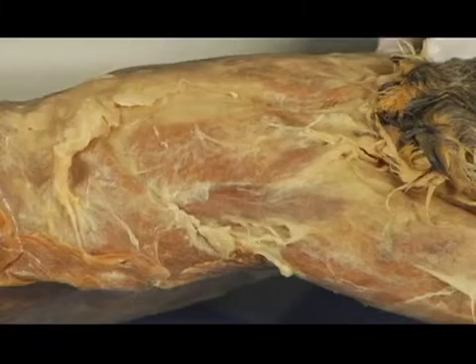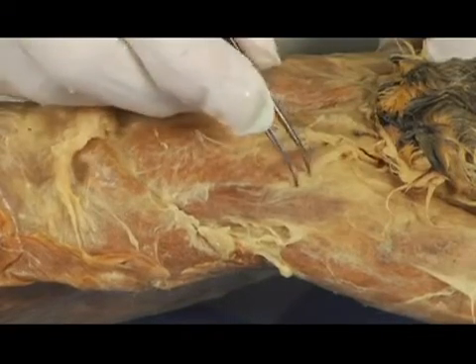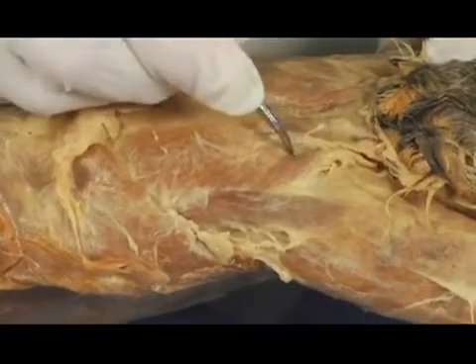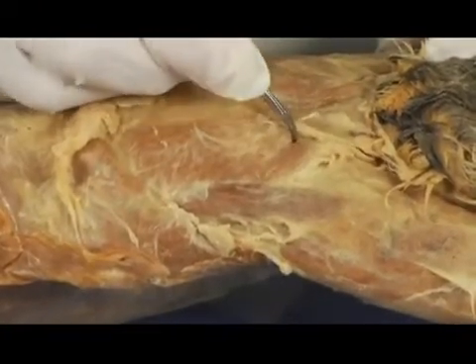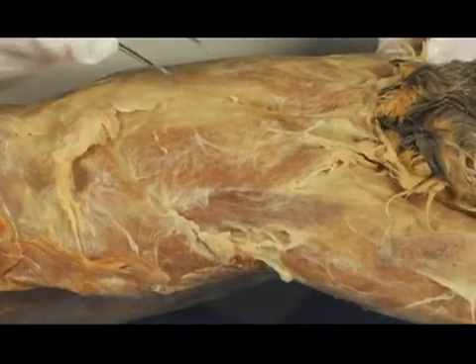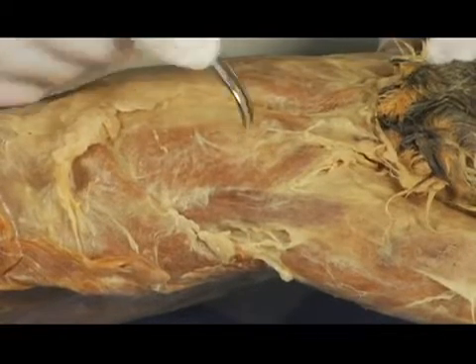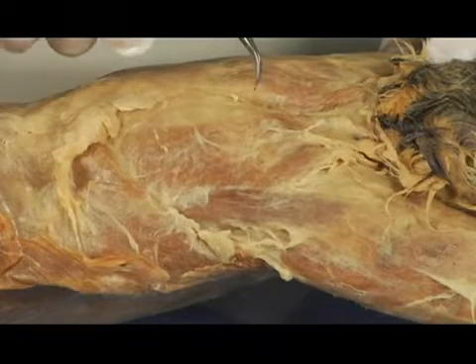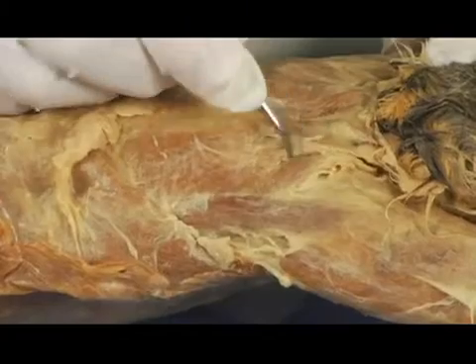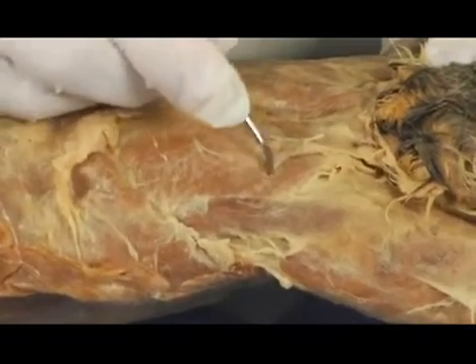Let's see, what do I want to use here? I guess the tweezers are good. Move a little bit more tissue. And once you get the muscles kind of in view, the next thing is to try to separate them. And again, the tweezers are very, very good for this because they've got a nice sharp little point, but it's not too sharp. And I'm actually separating a muscle right here. There's sort of a border, and I'm separating it.